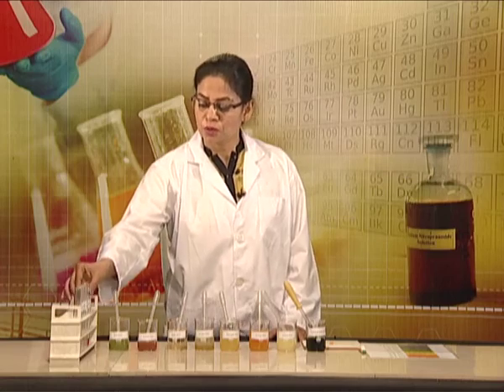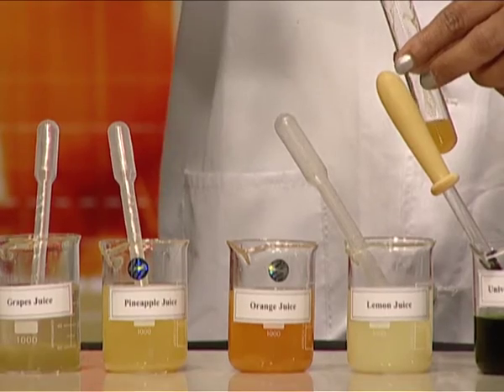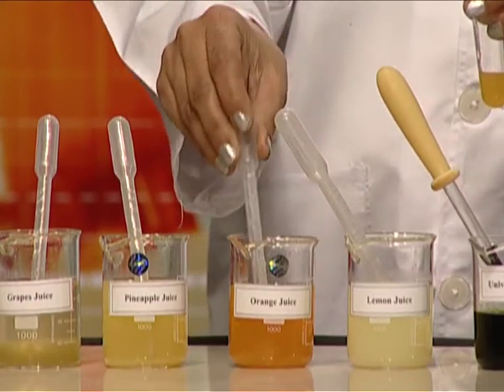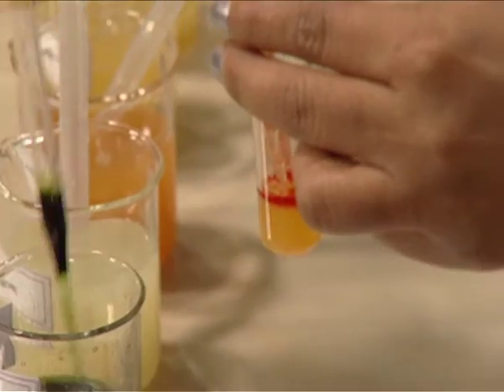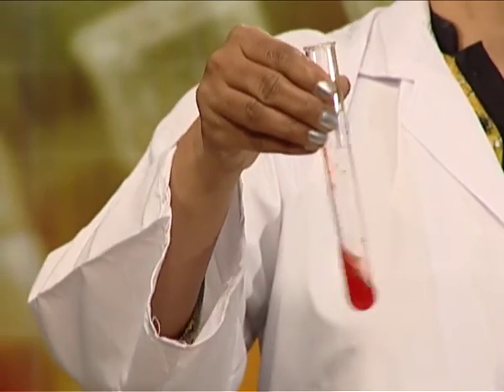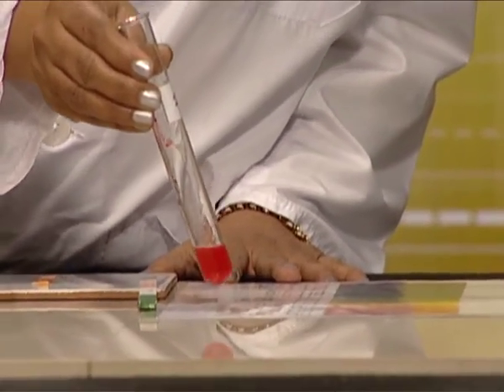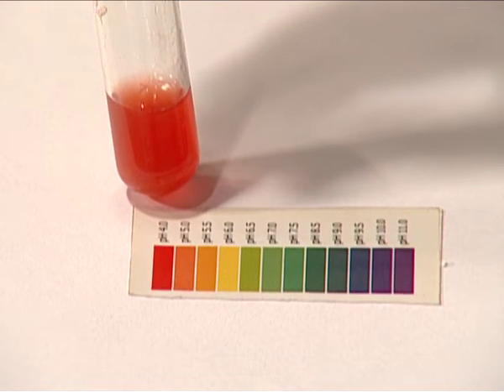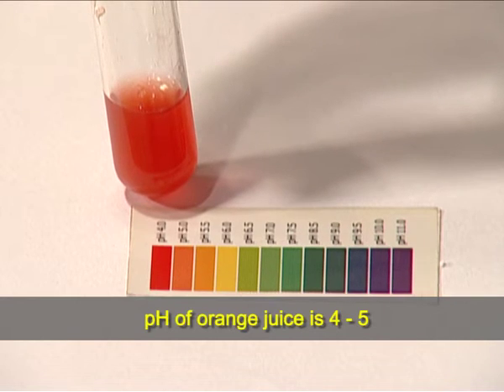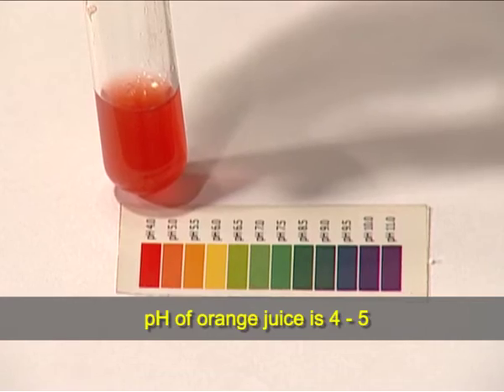Let us take test tube number 2 and add orange juice in the test tube. Now, I am adding 2-3 drops of universal indicator and shake the content of the test tubes thoroughly. Now, I will match the color with the standard pH chart. Orange juice has shown dark orange color with universal indicator and pH range is nearly 4, as you can see easily from the pH chart.